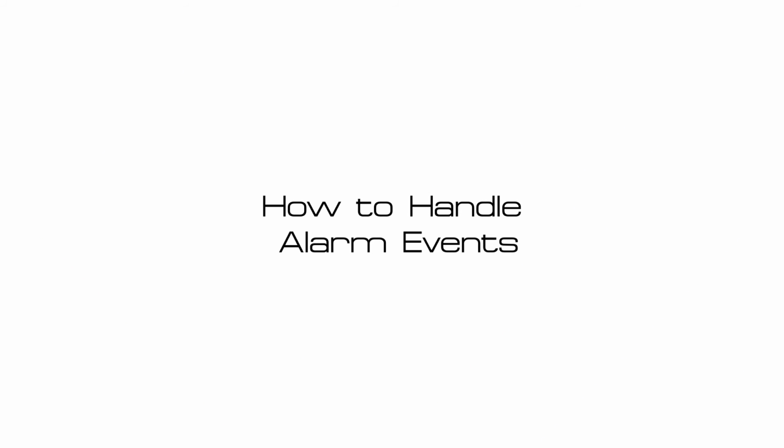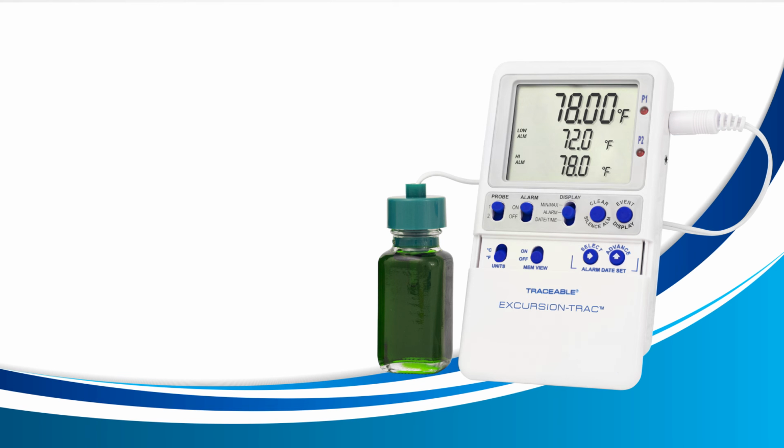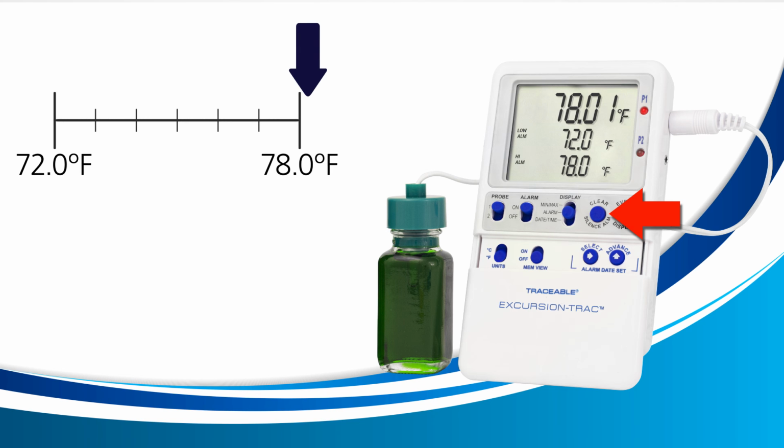How to handle alarm events. When an alarm triggers, there are two ways to handle the alarms. The first way to handle an alarm event is to use the clear button on the right. Pressing the clear button once will disable the current alarm. If the current temperature returns in between its low and high alarm, and then leaves the range again, your device will ring once again, as this has created a new alarm.